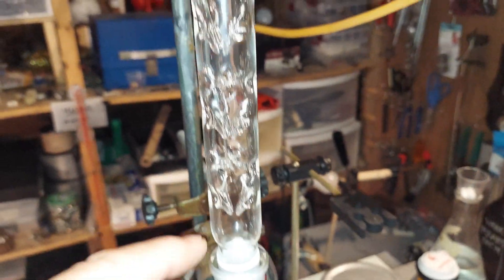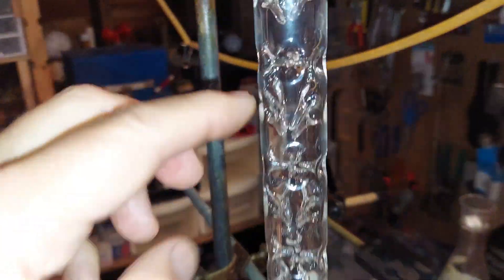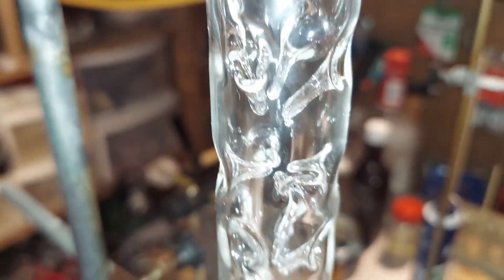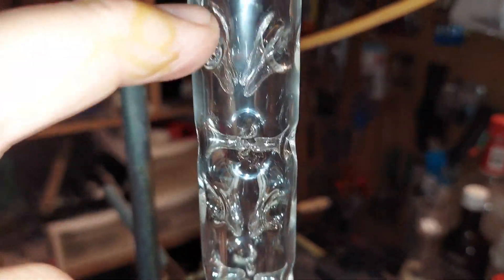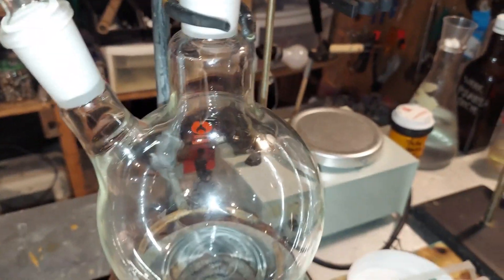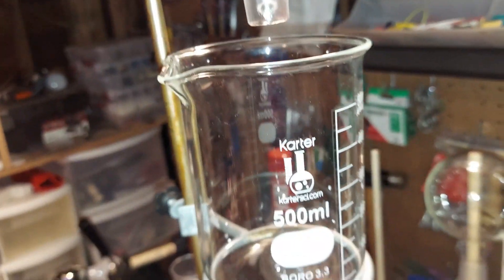The water will come over first as it comes up, drips back down, comes up, drips back down. This has little holes in it which show as protrusions on the inside. As these slowly heat up, the water will make its way up faster, but the nitric acid will continue to drip back down. Eventually the water will get to the top, come over, and I'll collect it here.